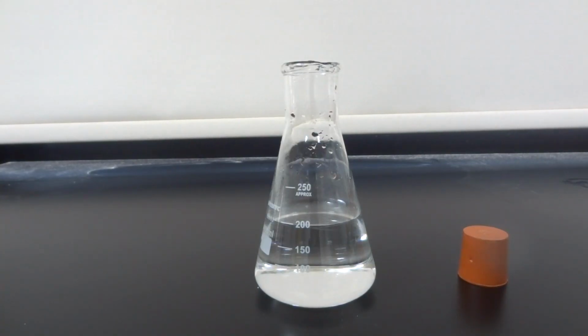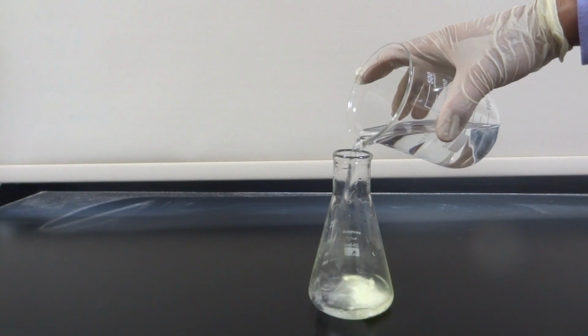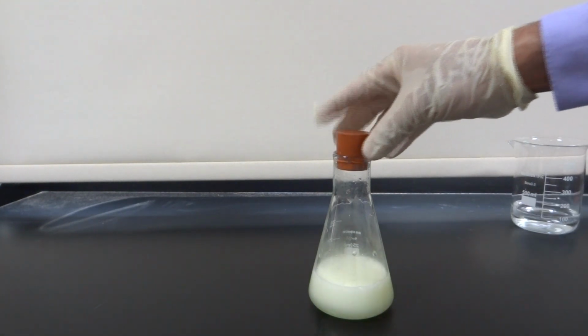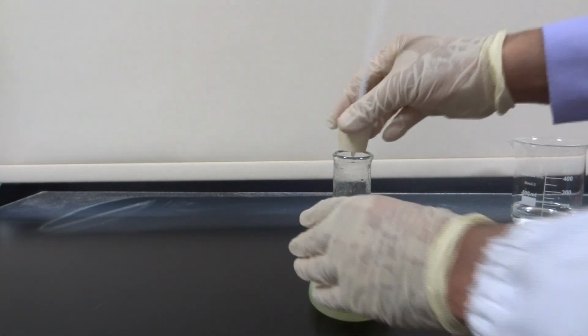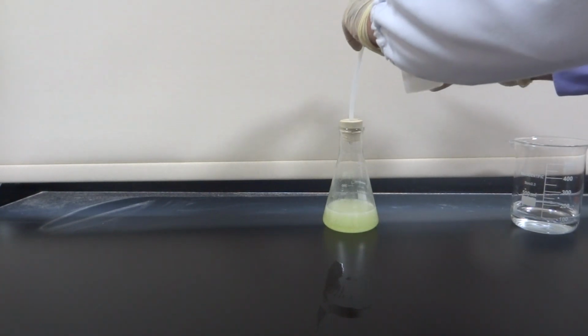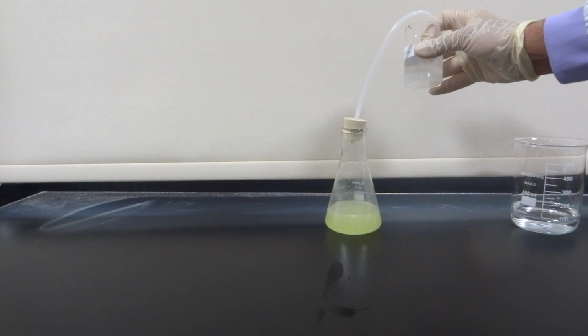The conical flask can be closed by using a stopper, but never close the conical flask when you're mixing, especially with a chemical which releases gas, to avoid the increase in pressure and then explosion. The narrow neck of the conical flask is helpful when you need to collect the gas released by a chemical reaction. So, you can use a stopper with a delivery tube. In this experiment, the scientist is testing the kind of the gas released.